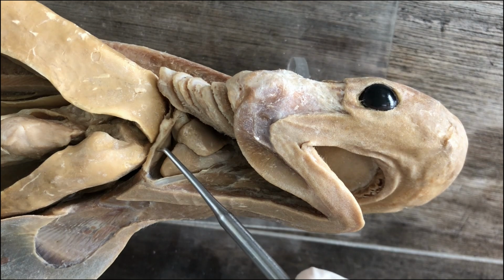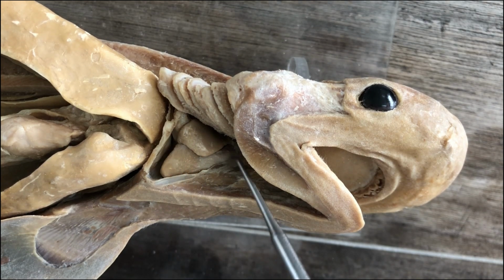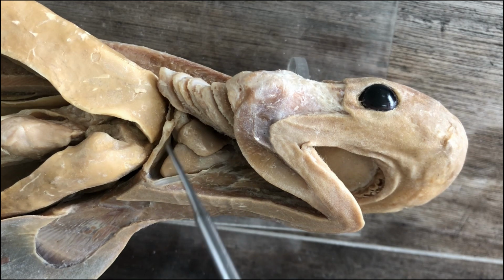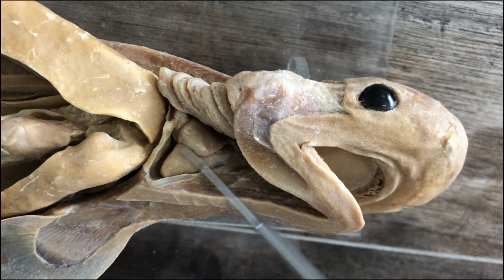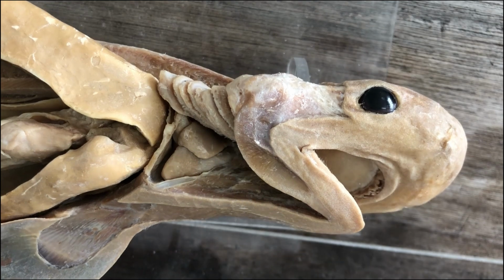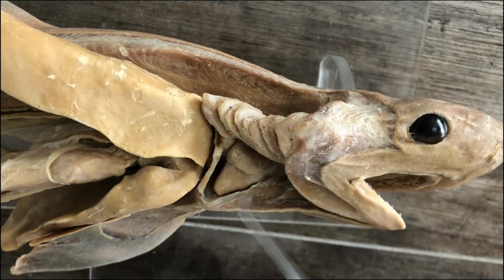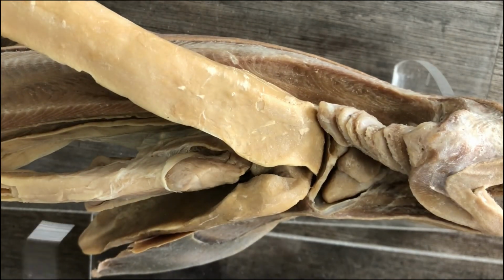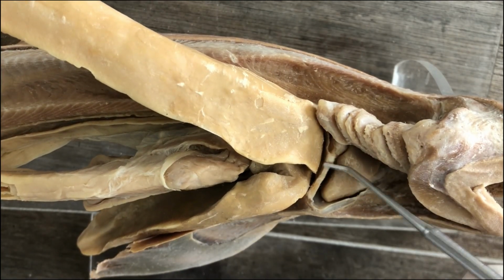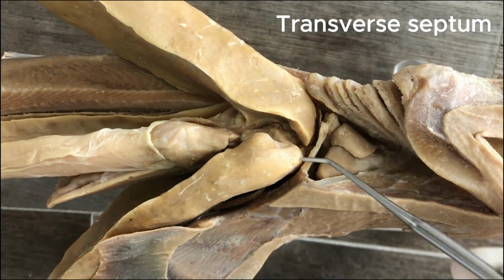So there's a parietal pericardium, the membrane lining the outer wall of the pericardial cavity, and then there's the visceral pericardium fused to the heart itself, and this is the heart. Now there's a structure separating the pericardial cavity from the pleuroperitoneal cavity, and it's this one. This is the transverse septum.